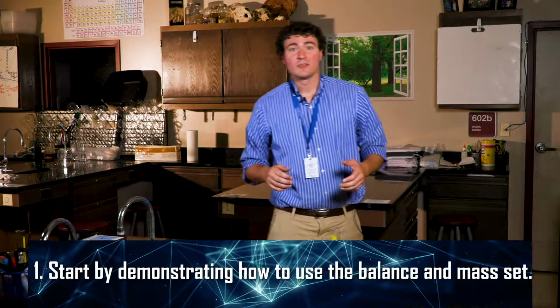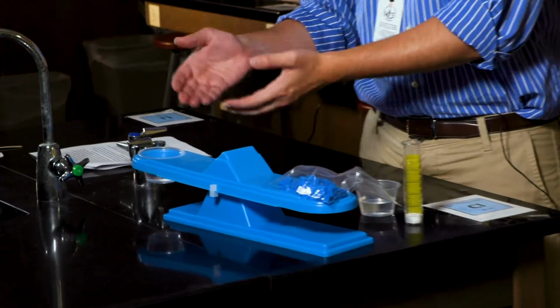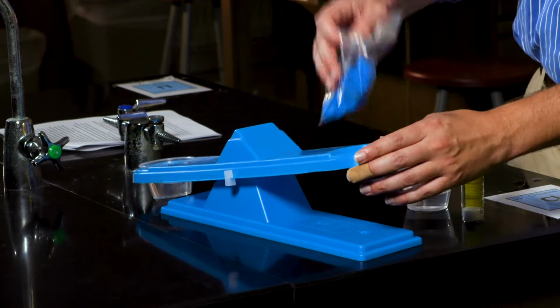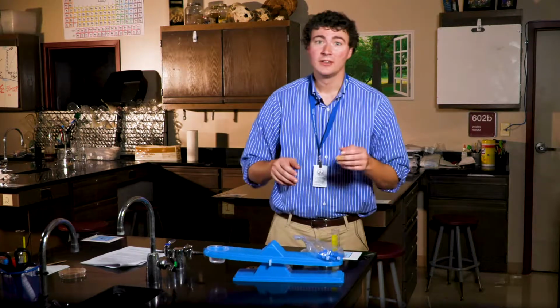The lesson begins with the teacher demonstrating how to use the balance and the mass set to weigh a 50 milliliter container of water. We set the cup on one side and we add 1, 5, 10, or 20 gram blocks to the other side as needed until both sides are balanced.